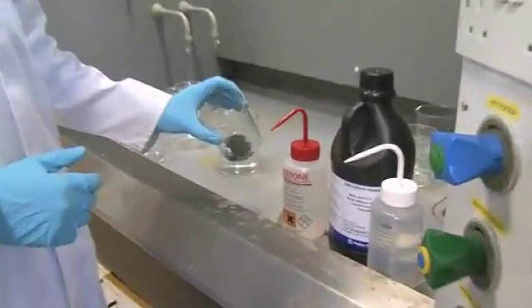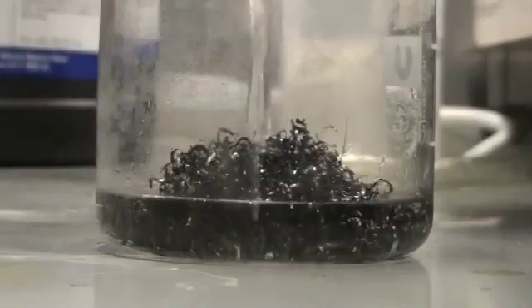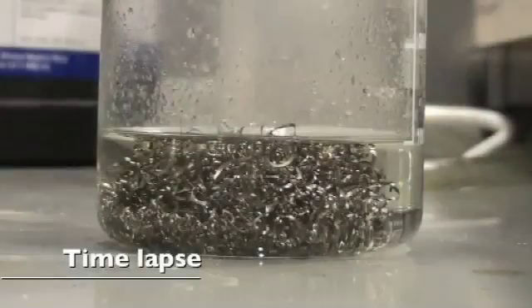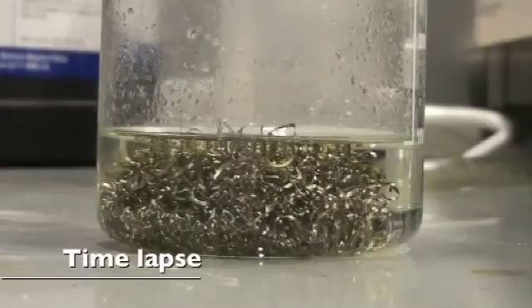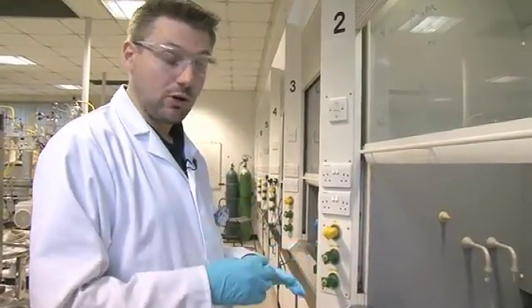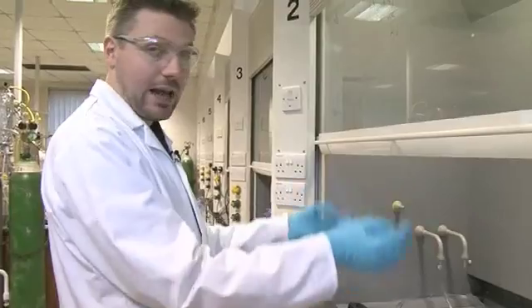So now we've got these turnings free of the oil, and we're going to treat them with concentrated nitric acid to clean them up. This is a very strong acid so you have to handle it quite carefully. Chemically, right now the HNO3 — the nitric acid — is reacting with what on the surface is UO_x. It's going to react to make water and NO2, so that HNO3 is going to fall apart and reorganise. As you can see, the solution is starting to get a little bit of colour — the acid is attacking the oxide layer, generating little bits of NO2 going off and generating water at the same time. So it's got this sort of yellow colour to it already; there's not a large amount of NO2 being given off, but there's a little bit.